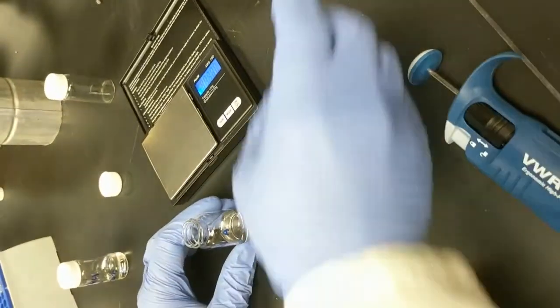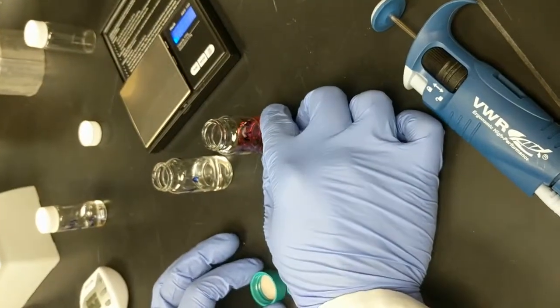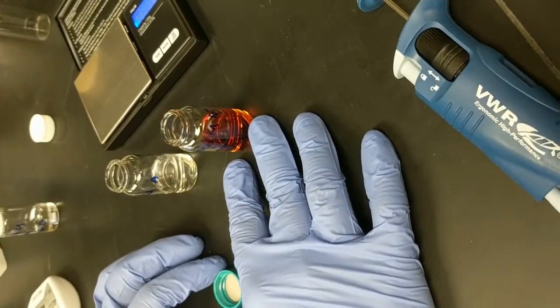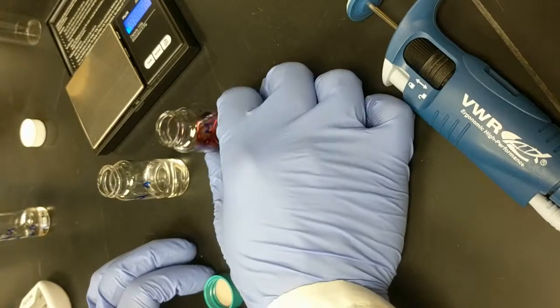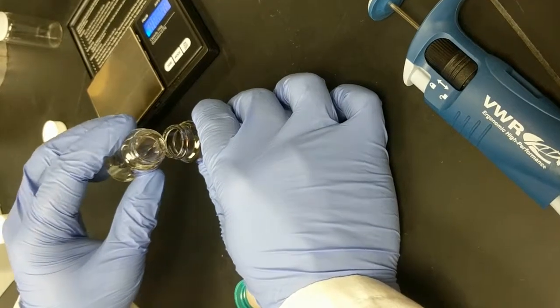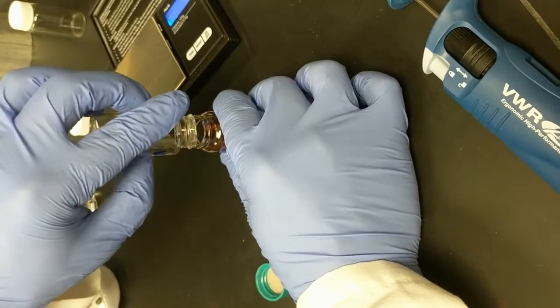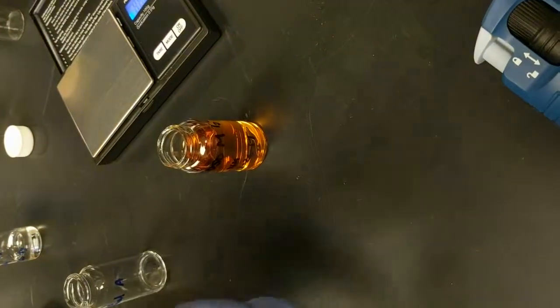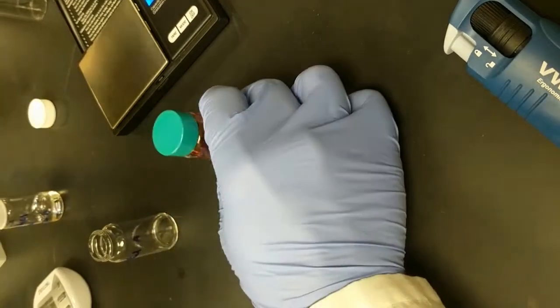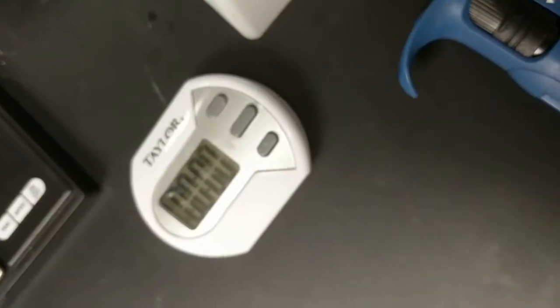Next, I'm going to pour the contents of vial A into the 0.0050 molar triiodide solution. There's 10 mils here that have been pre-measured. If we created a test kit for you, you should find vials like this within the test kit. Alternatively, you could pipette 10 mils of the triiodide solution directly into the vial A. Or you could also do it by mass. Shake the vial a little. And again, set a timer for 15 minutes and wait. Alright, so that 15-minute time period is up.